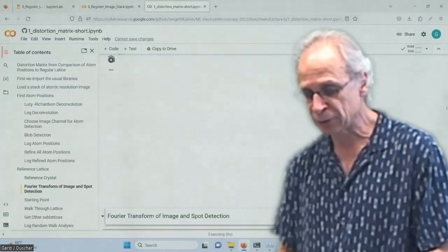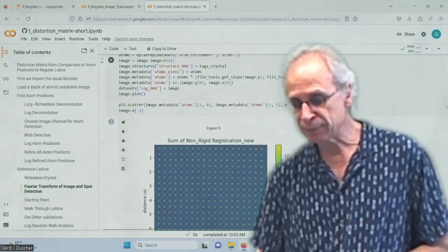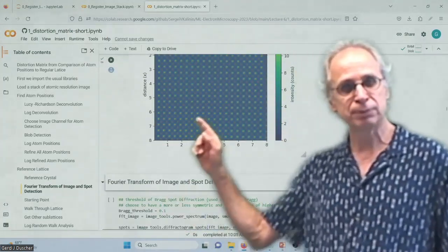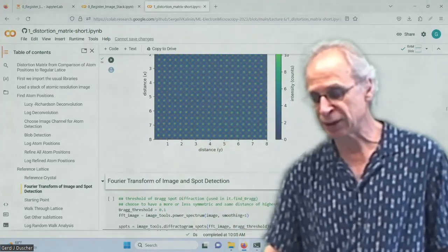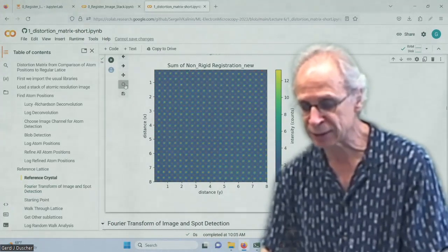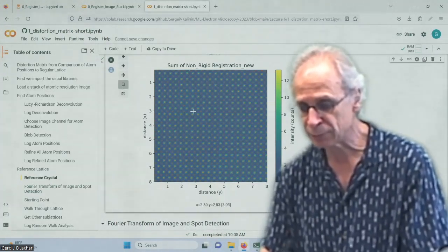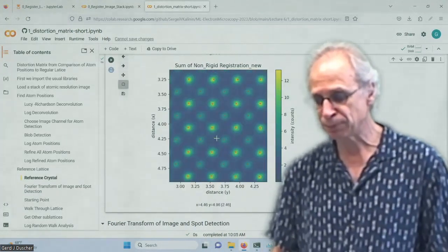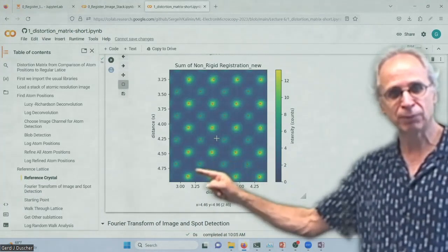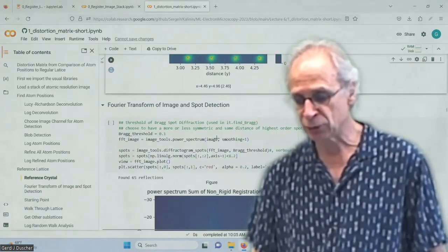And then I again look at what kind of image I want. I want to do that on the Fourier transformation, the original one, and I put my atoms on top, so those are the refined atoms now. We don't see that very well. Let's zoom in a little bit. Maybe the zoom does work now on my screen. Okay, so we have the atoms determined, all of them. So the Lucy-Richardson deconvolution worked.